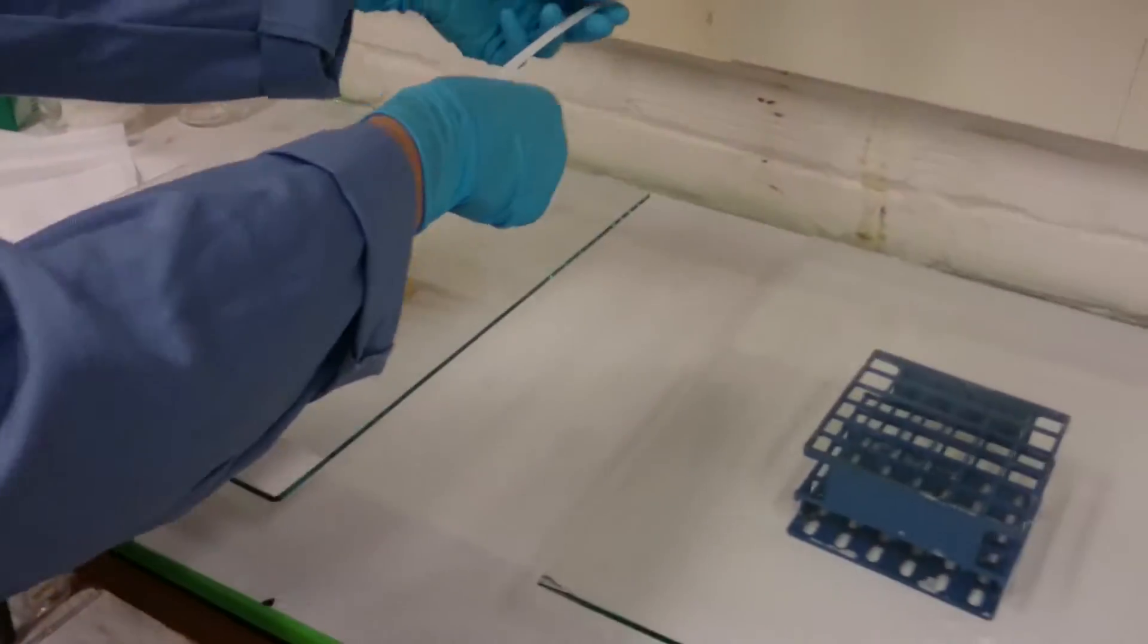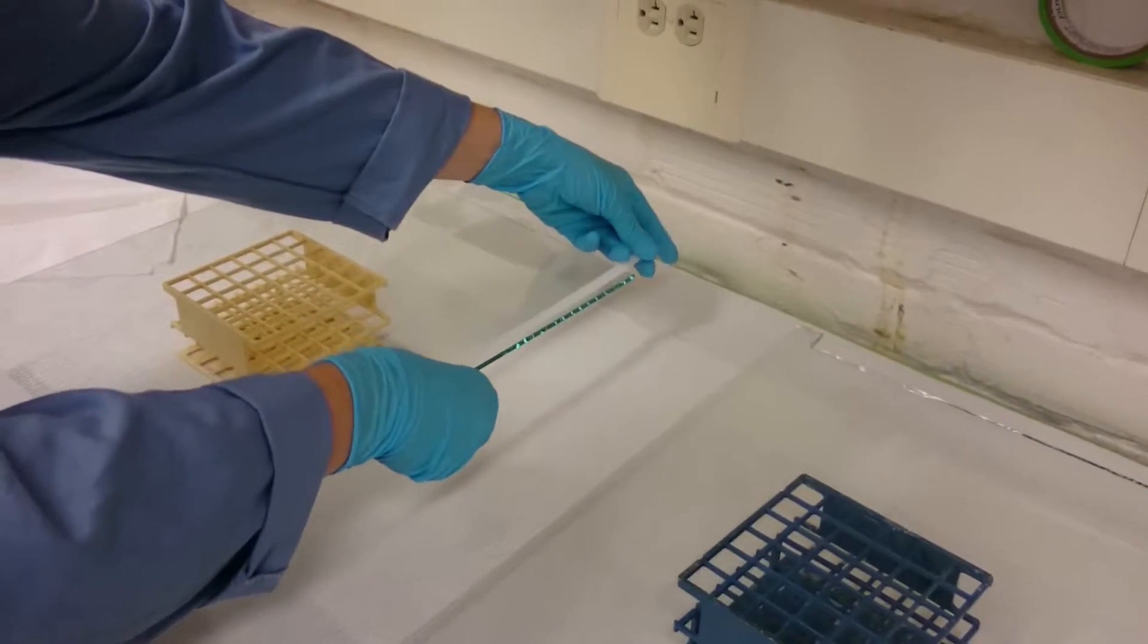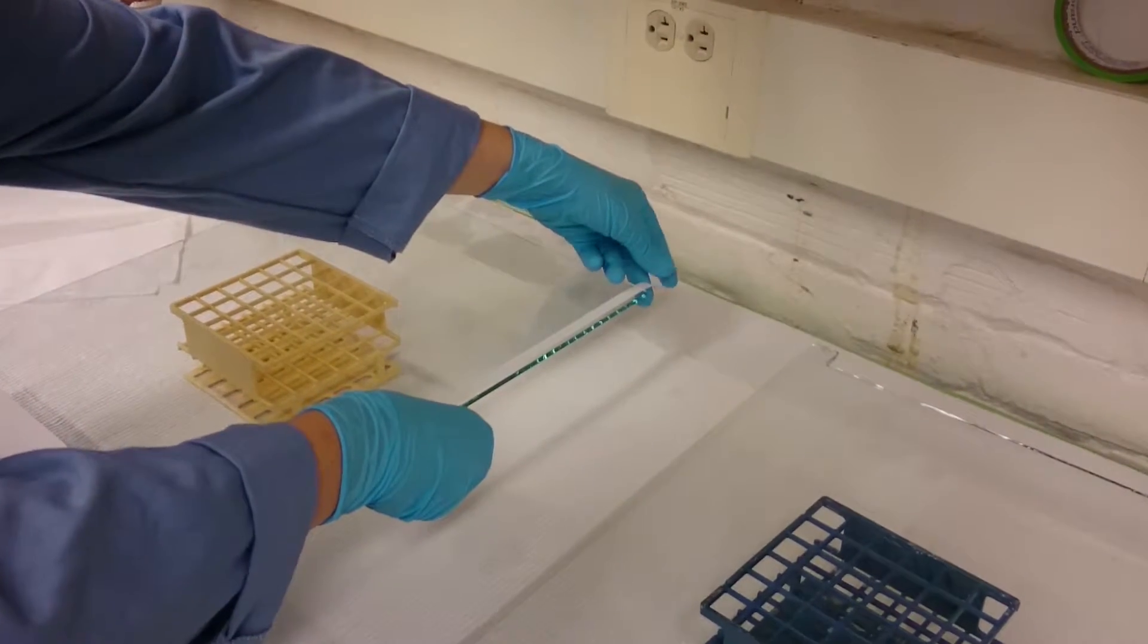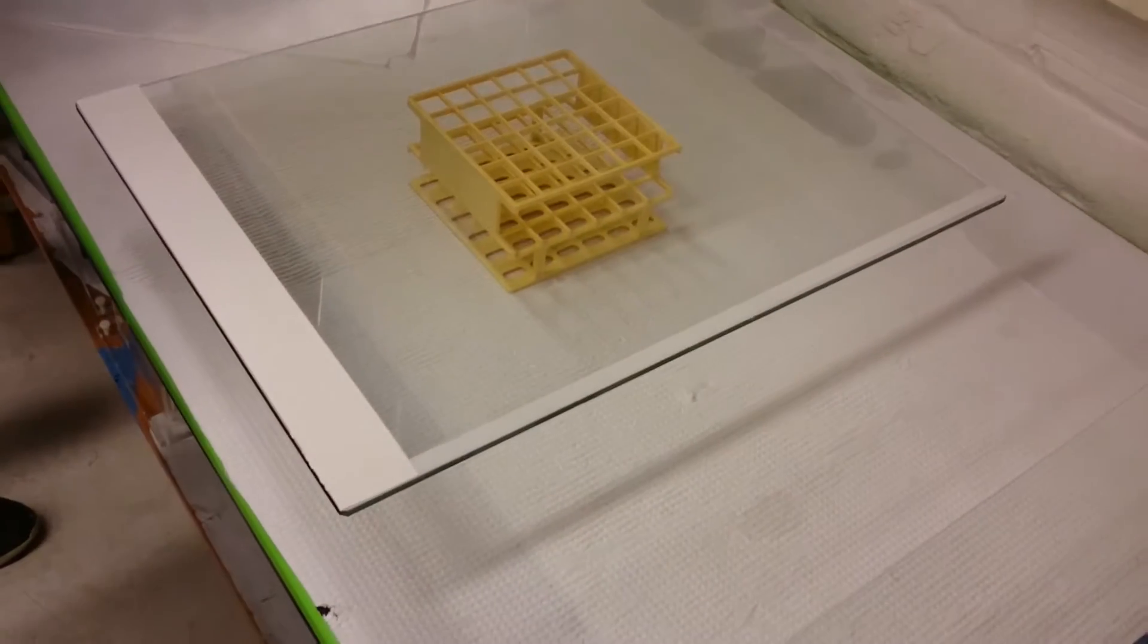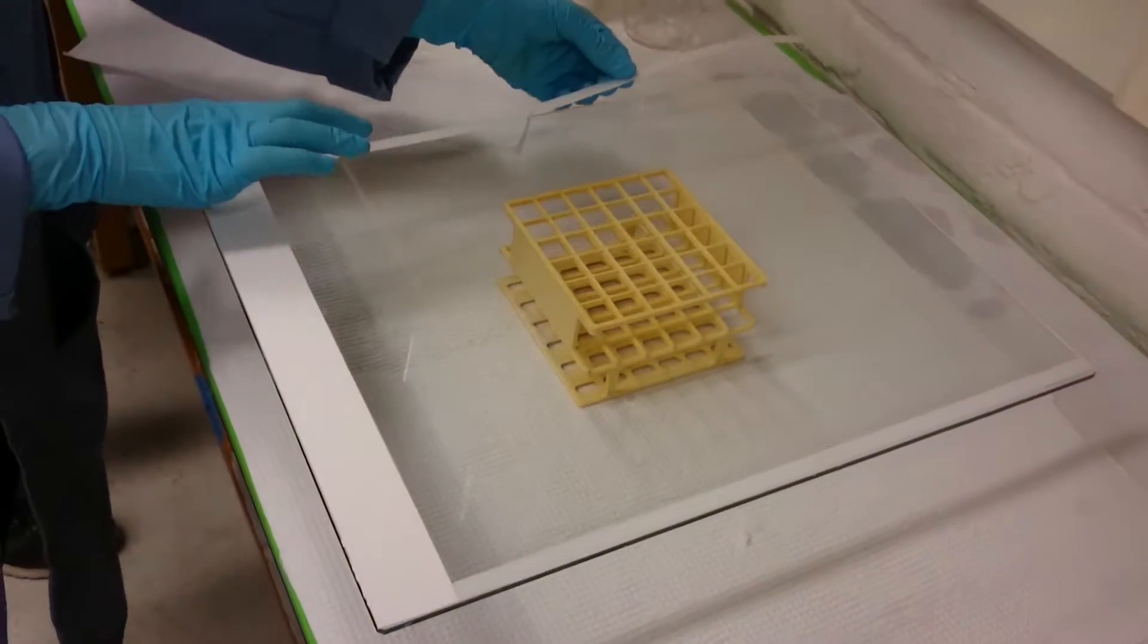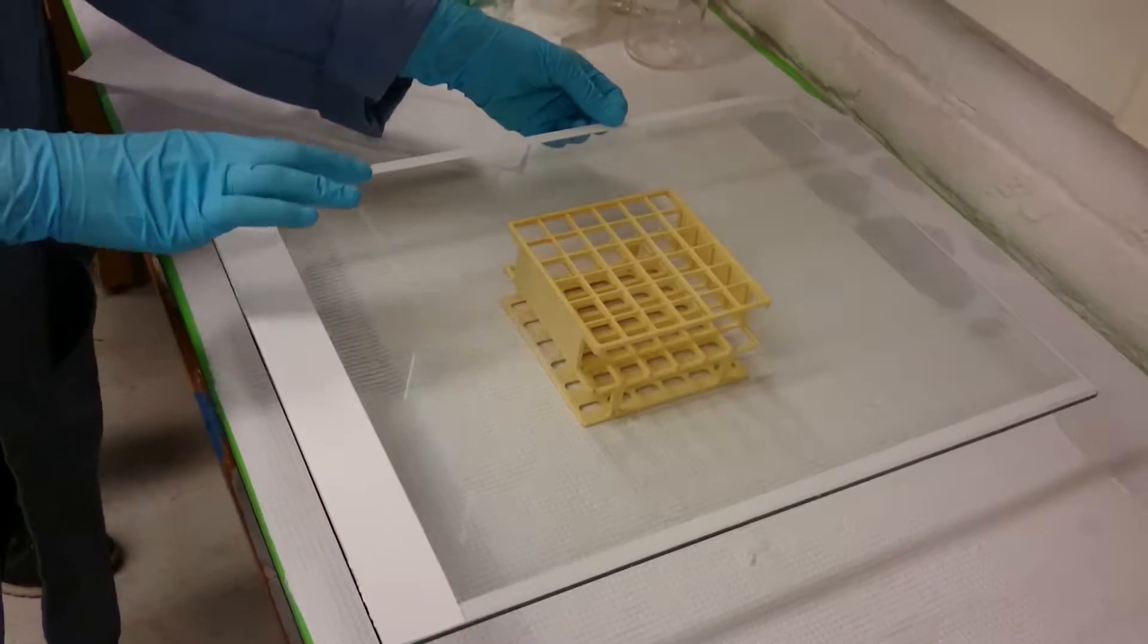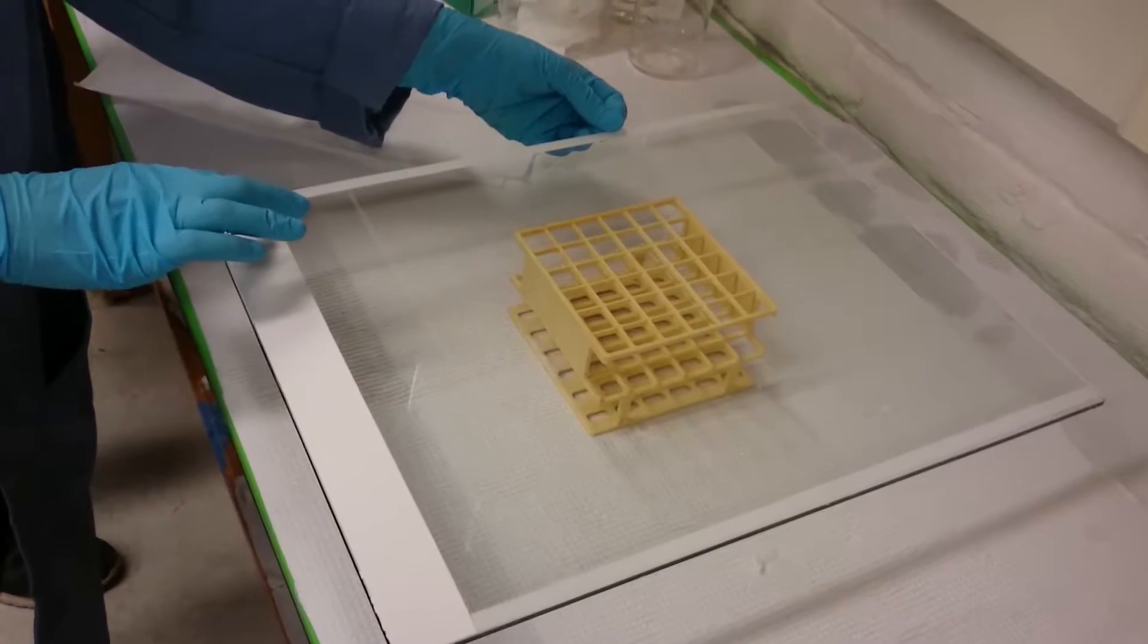Now I'm going to actually put the spacers down, and you want them right up against the top of the filter paper. Second spacer. And the spacers, of course, have also been cleaned.